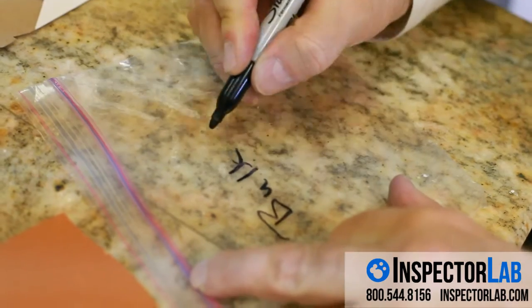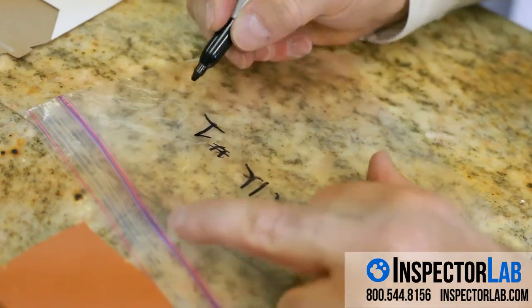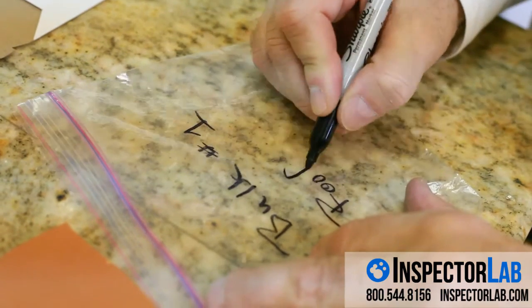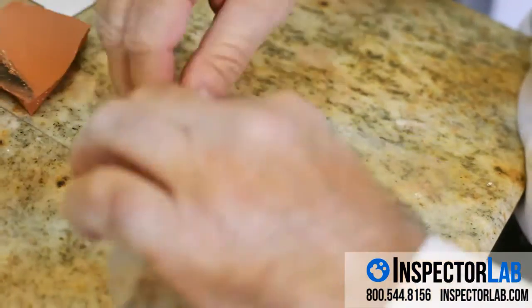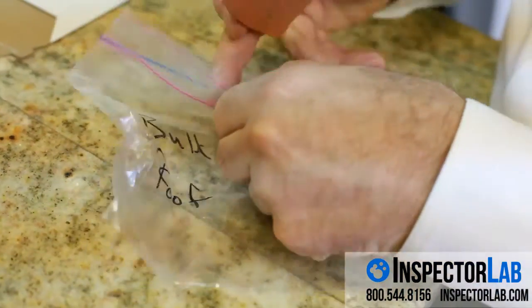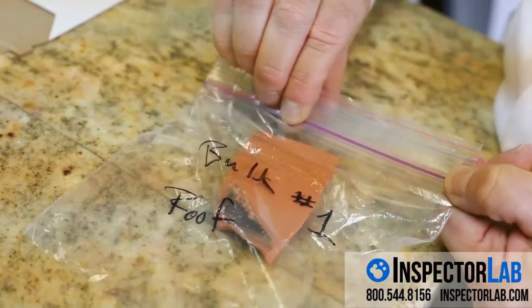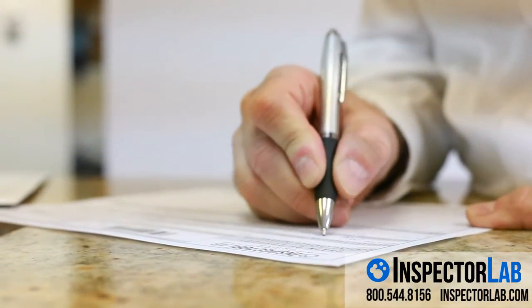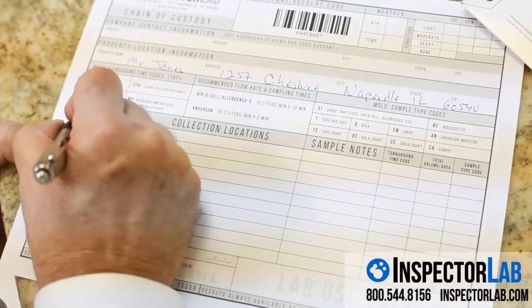After the bulk sample is collected, carefully place it into the Ziploc bag and seal. Give the bulk sample a unique number of some sort — the InspectorLab app on your mobile device will give you a unique number if you're looking for one. Label the Ziploc bag with the sample location and serial number. Record the bulk sample serial number and sample location on the chain of custody or in the InspectorLab mobile app.